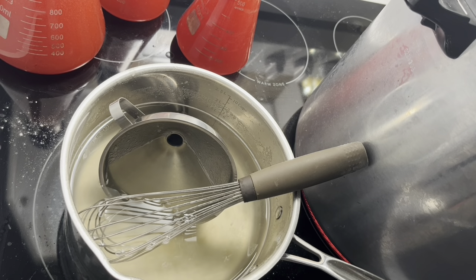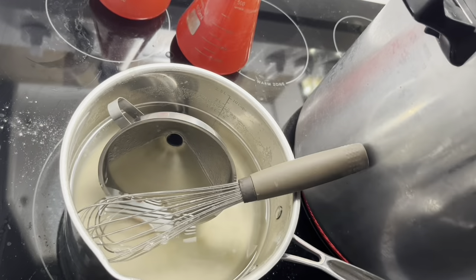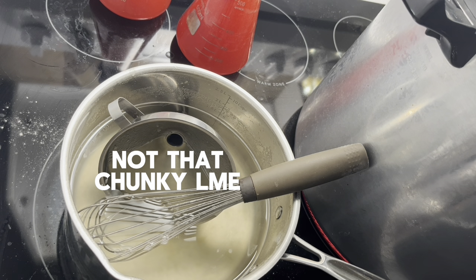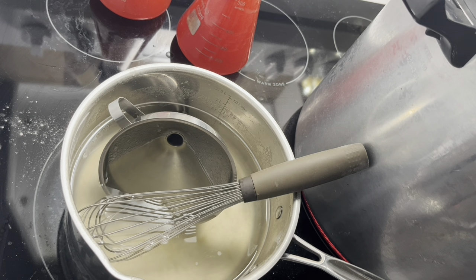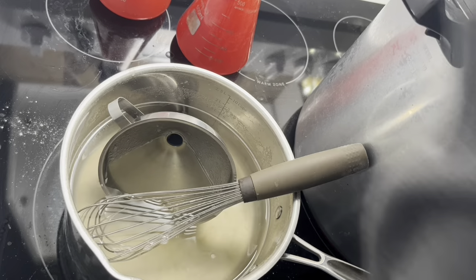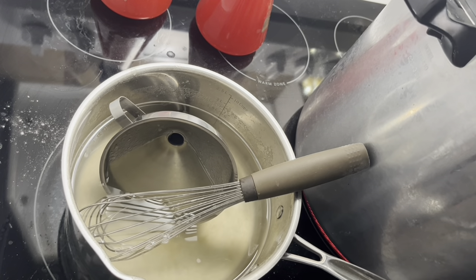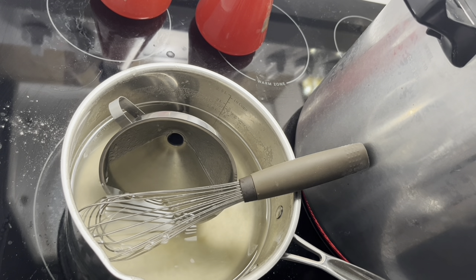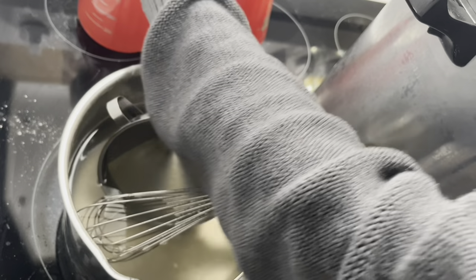A lot of people say you don't have to pre-cook it — you could just put all the ingredients in the flask and run it — but I don't do that anymore. I used to, and that's fine, but in an effort to get really crystal clear agar, I feel like pre-cooking helps the mycelium digest it better and faster. I've gotten much better results by cooking it first.